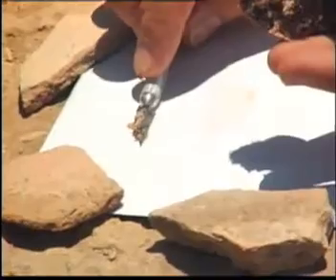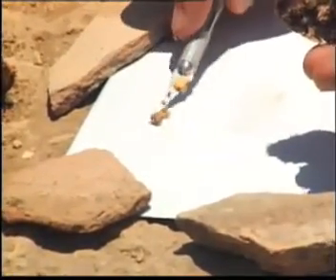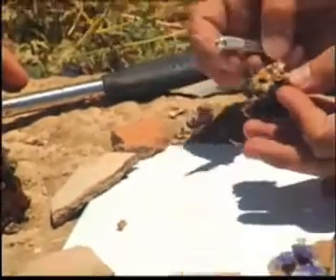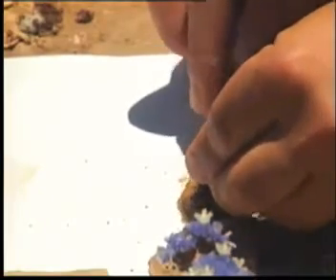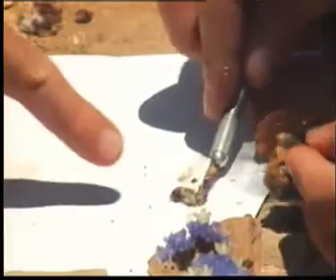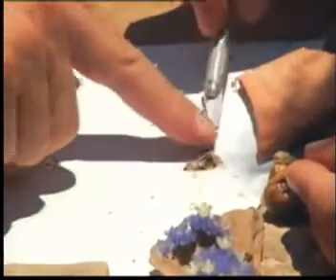Inside the gland there's a clear liquid which, when exposed to air and the enzymes also in the gland, will change the clear precursors of the dye into the dye itself. You'll see this getting reddish, purplish, blue in a few moments. Does it need sunlight? Some of the literature says it does, some says it doesn't, so I don't know the answer to that question.